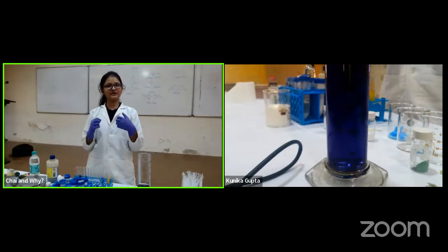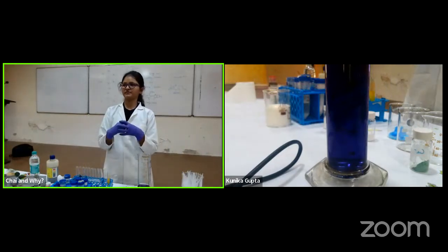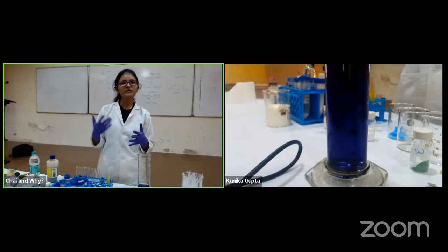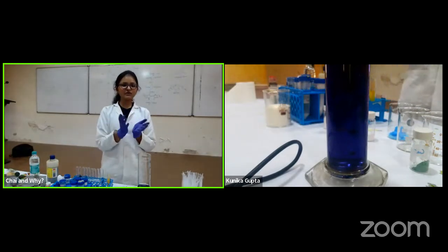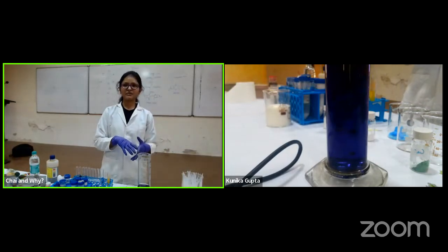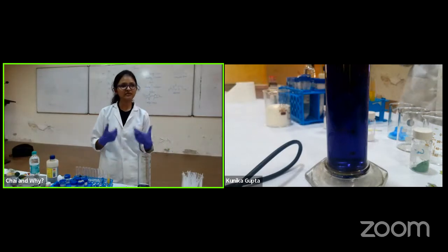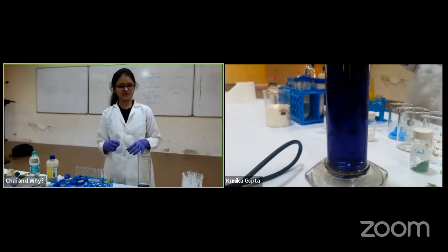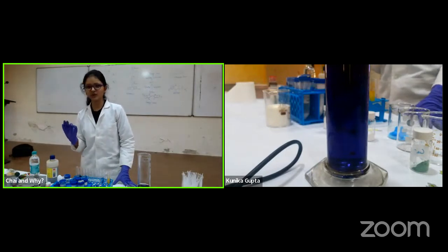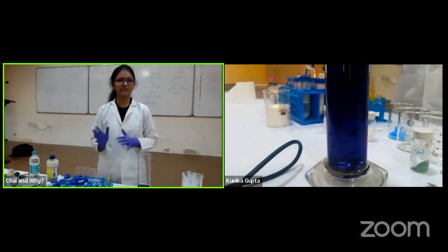So what is dry ice? Ice is a normal thing, this ice is water solidified. Dry ice is carbon dioxide solidified. So why do we need it? Because with ice, the temperature only goes down to 0 degrees. But if I want to go to a much lower value, we need something else, right? So for that we have dry ice, which, as I said, is solidified carbon dioxide. Now when I add it, let's first see what happens and then I'll give you an explanation.